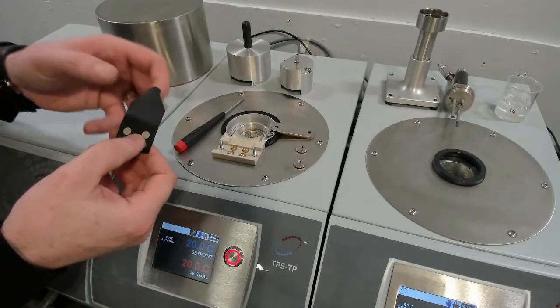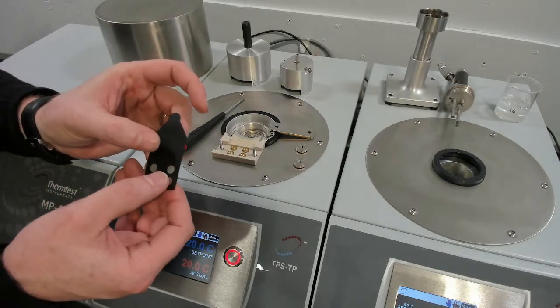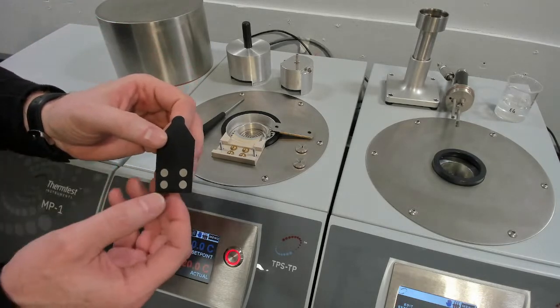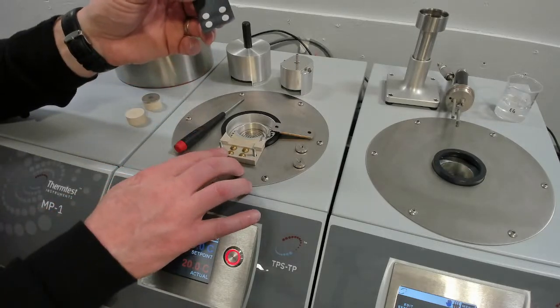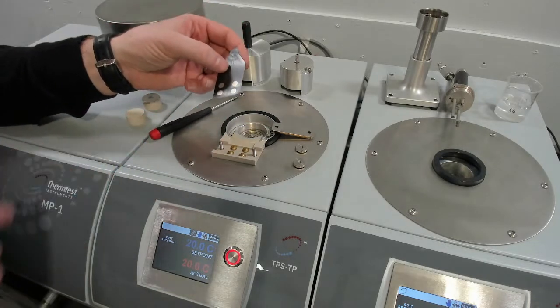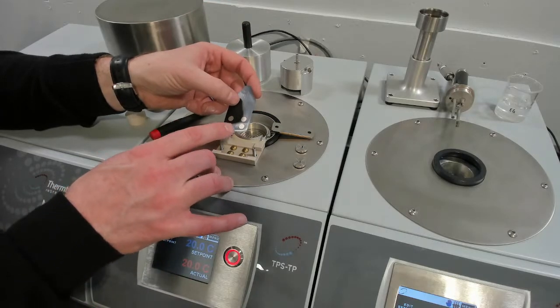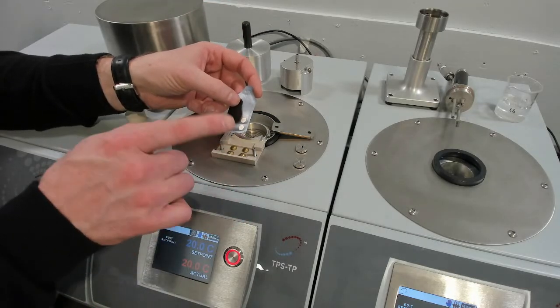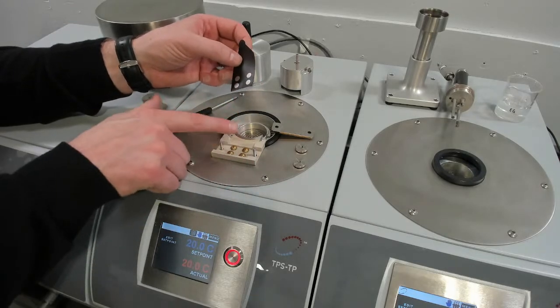So of course from our different demonstrations you've seen our sensor. This one is 3.2 millimeters radius or 6.4 millimeters diameter. 4 contact points. Those are made outside the heating and cooling. So that's unique in a couple ways. One is it maintains longer life for the sensors because less of the sensor is exposed to the heat, but the 4 contact points are made outside the heating with these there.